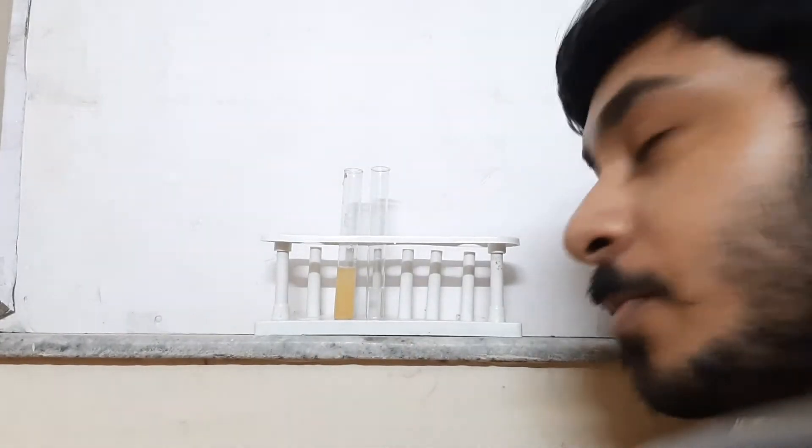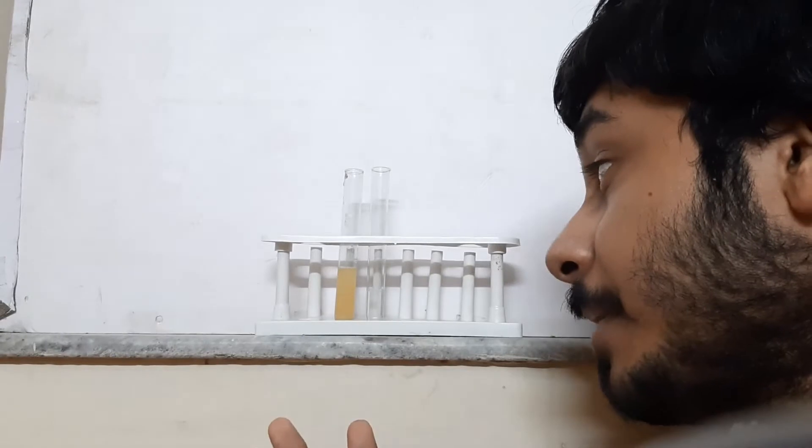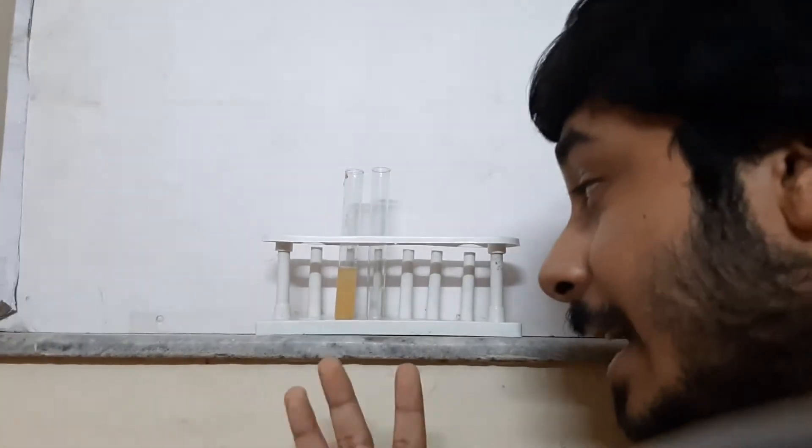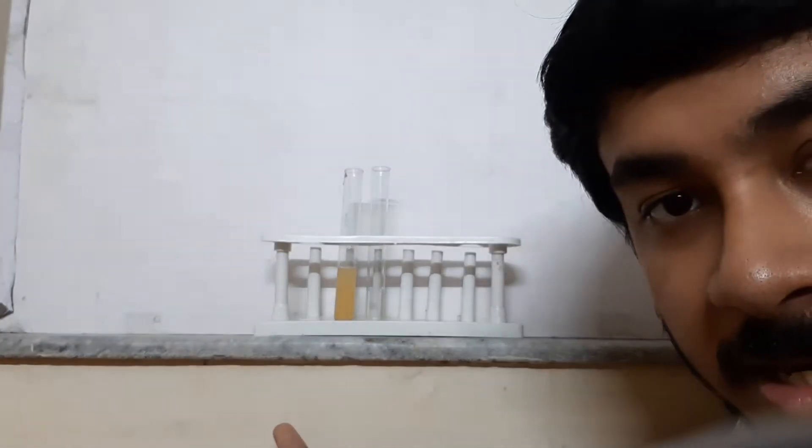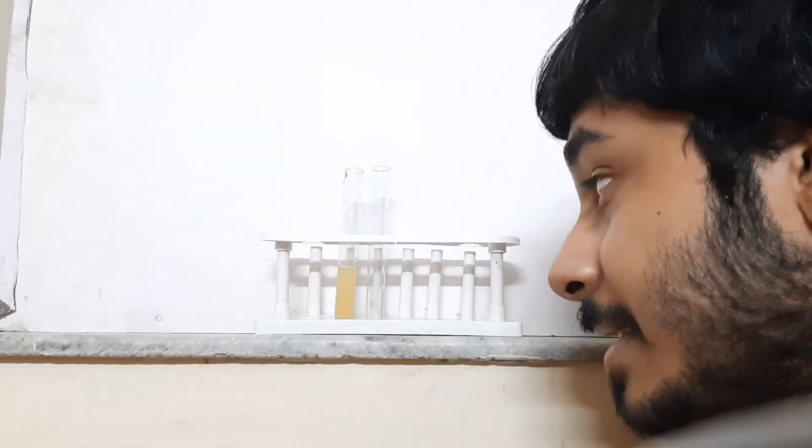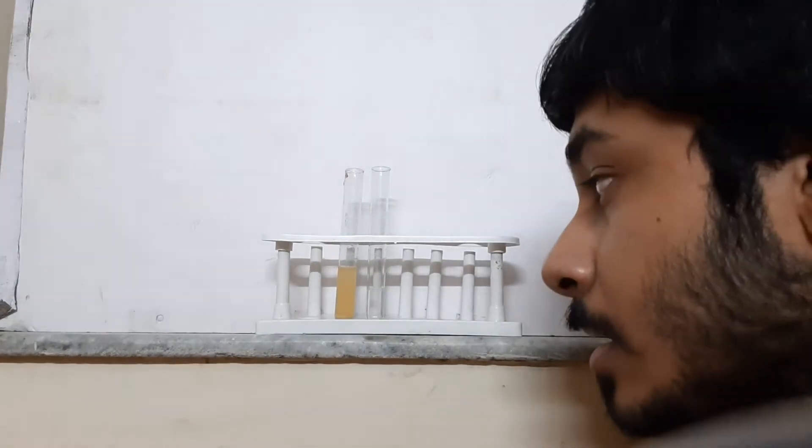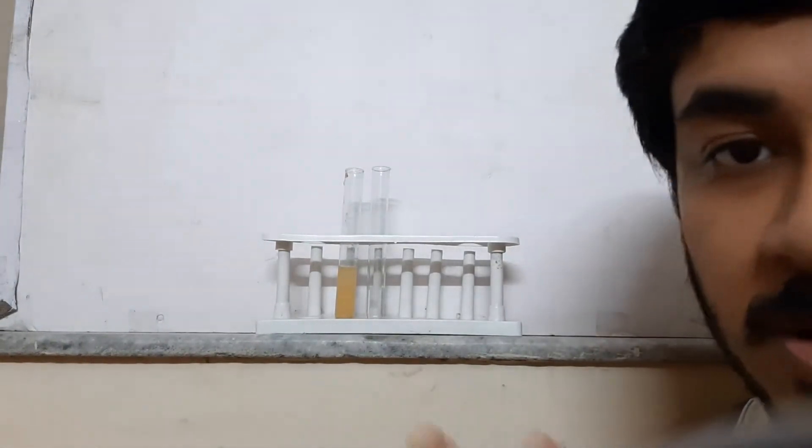Hi guys, I'm back with another simple experiment. I'll be adding FeSO4 (ferrous sulfate) to sodium hydroxide (NaOH). As you know, sodium ranks higher in the electrochemical series than iron, so iron will be displaced. Let's get on with the experiment, and then I'll provide a good explanation.